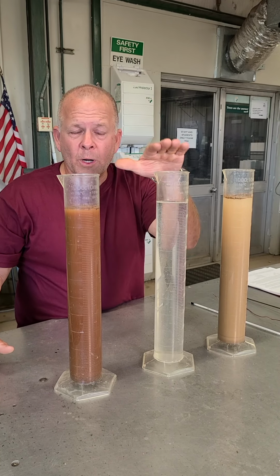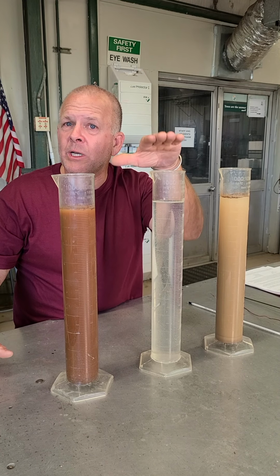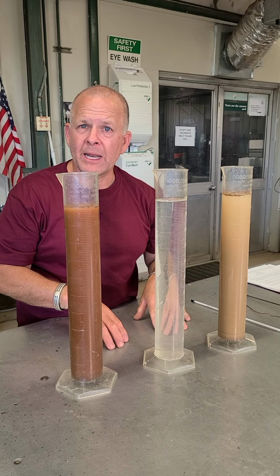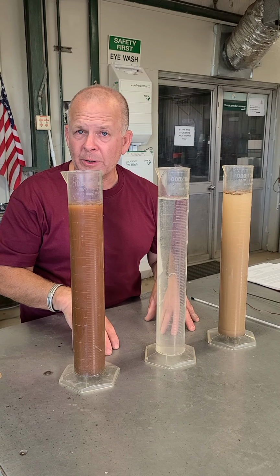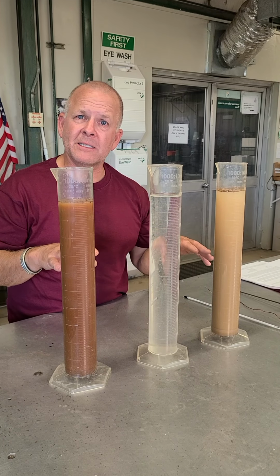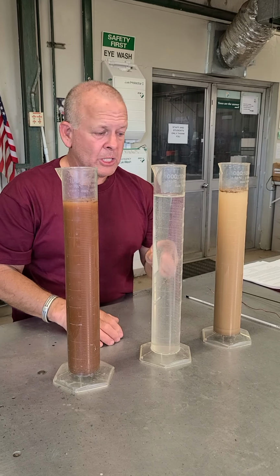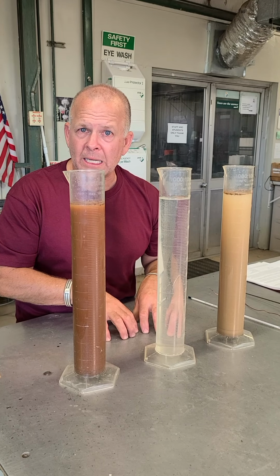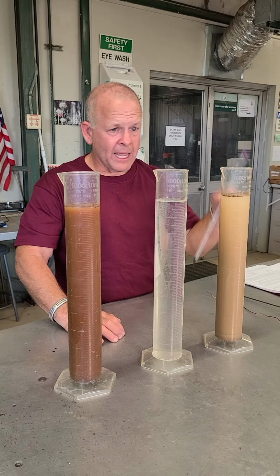So one of the other inputs to this Stokes law is we need to know what the temperature of the solution is. Today it's kind of warm in here, but if we ran this experiment in the middle of winter, the density of this liquid would be different just based on the different temperature. That changes the density of the liquid in here. We really don't know how the temperature is going to affect us, but we have a correction factor for that. So the important thing for us to do is to measure the temperature.